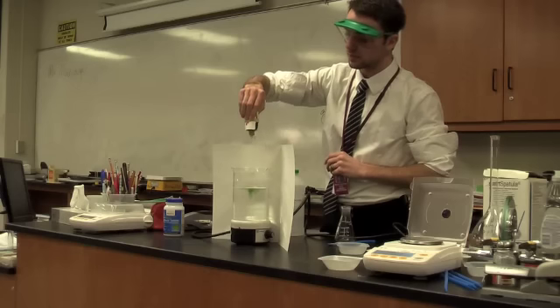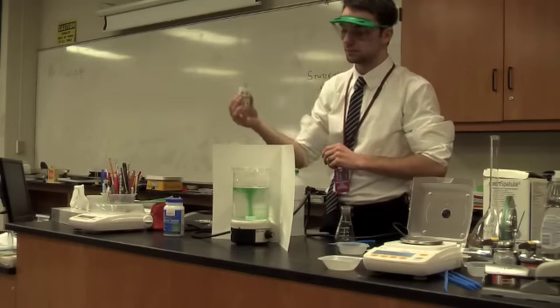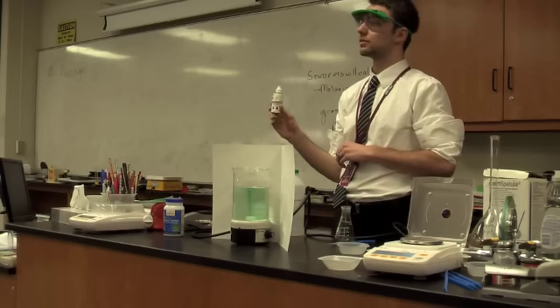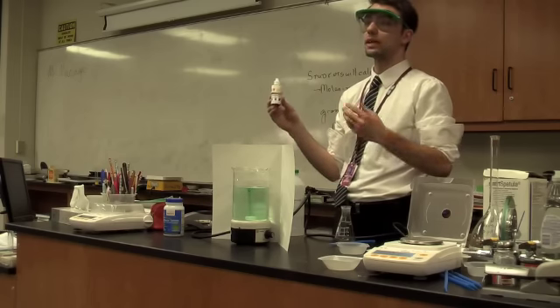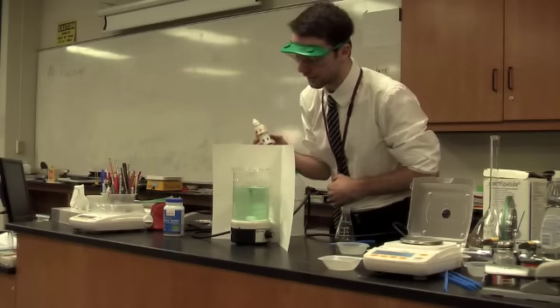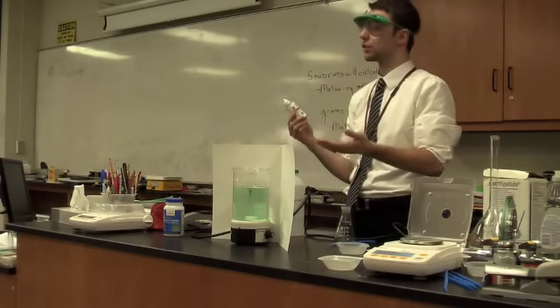Now what does this indicator tell us? What does the indicator tell us about the solution? Right, the pH of that solution. So for water, we would say it's green.